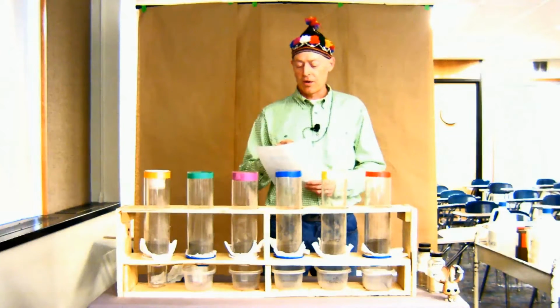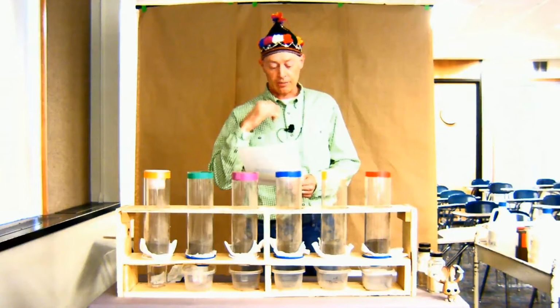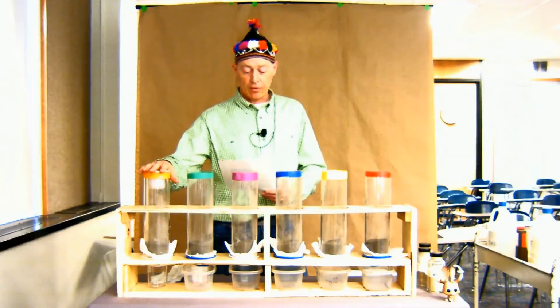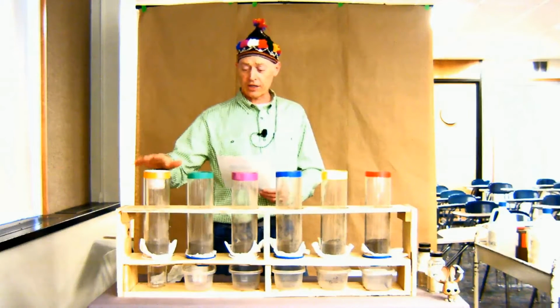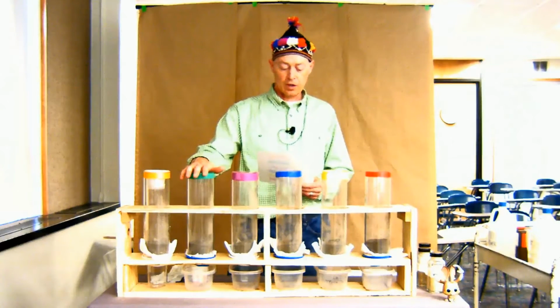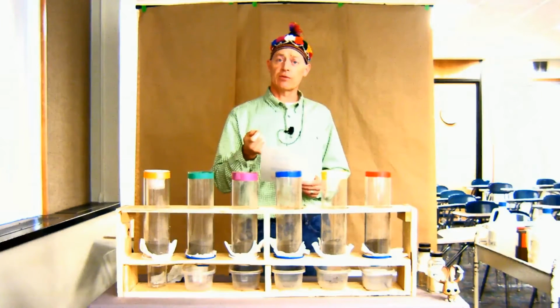So remember that it's kind of at that ratio cusp that we're talking about, where you want it to be less than 5x. So that's that one. And we're going to wash this one with deionized water, low electrical conductivity water. The second one is the same soil, but now we're going to add calcium chloride, half molar calcium chloride. The reason is we're going to add electrical conductivity, but we're also going to add that calcium, which is a flocculant.